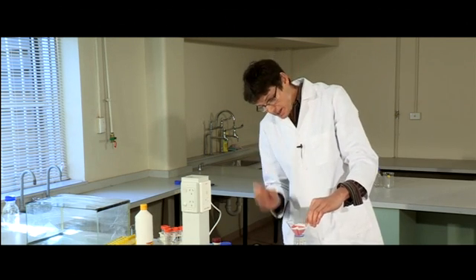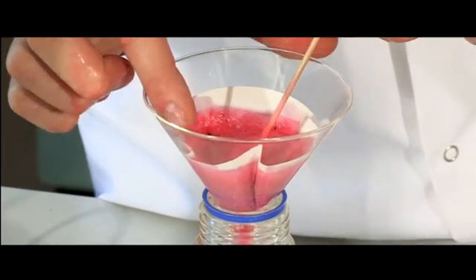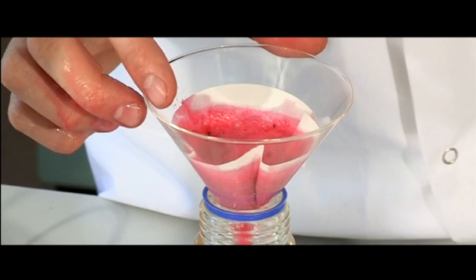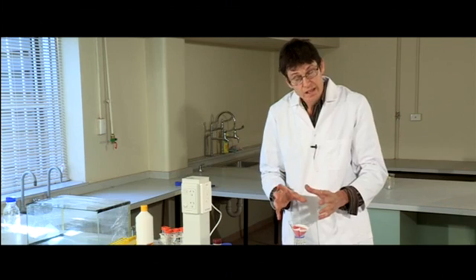The filter paper works very slowly, so you might have to give it a helping hand. Get your skewer, give it a gentle swirl, and that will help it move through the filter paper a bit quicker. Now that takes a long time.